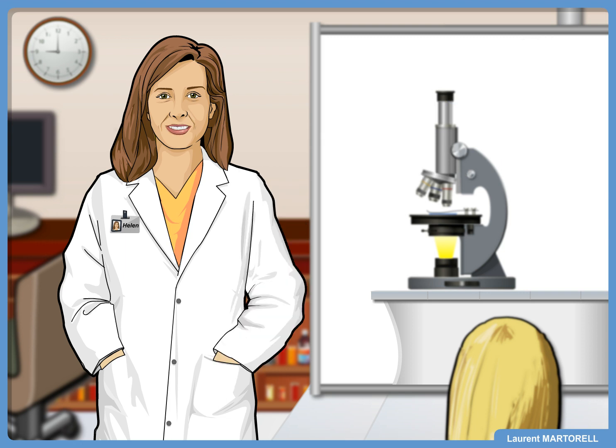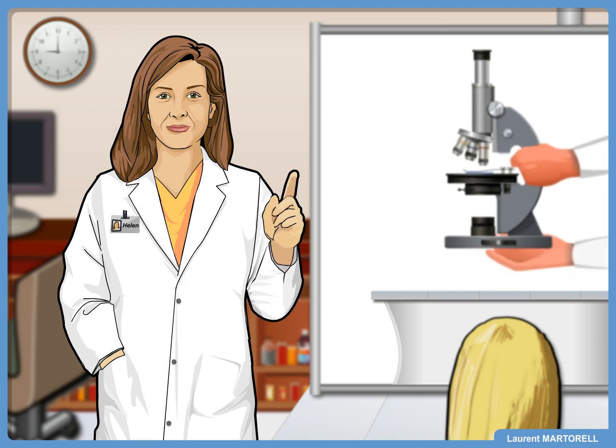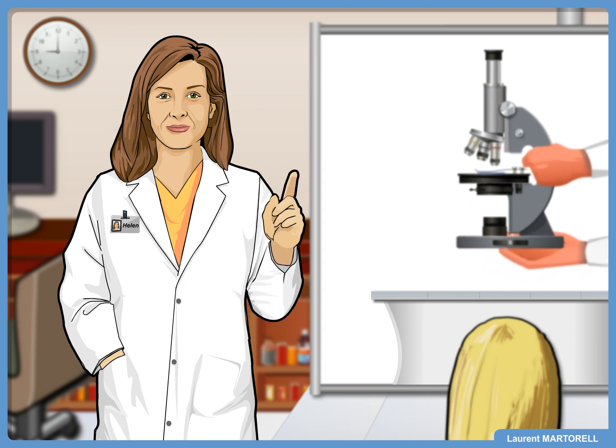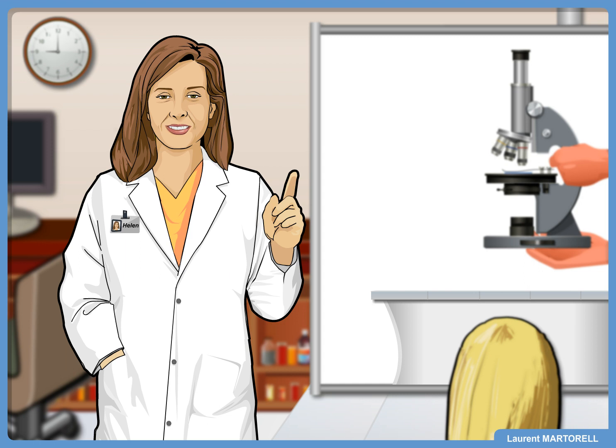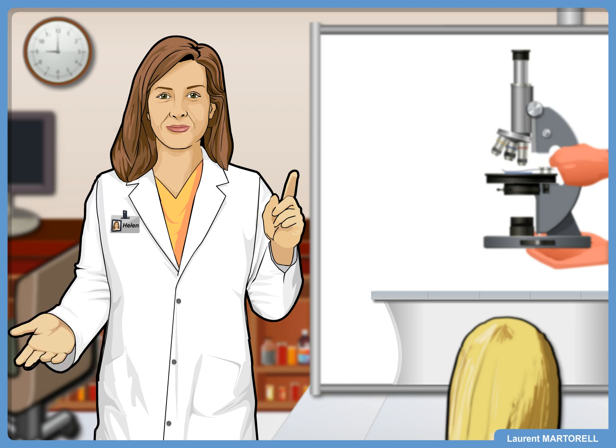Now that you know almost everything about the compound light microscope, it is up to you to practice. To carry the microscope, grasp the microscope's arm with one hand and place your other hand under the base. Now you are ready to study cells and other microorganisms, and who knows, you may even discover new species.